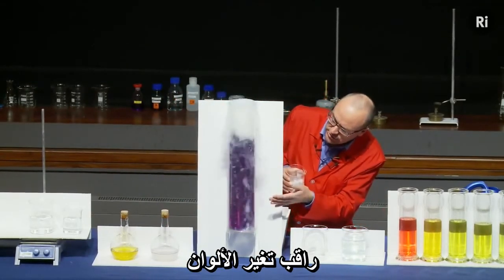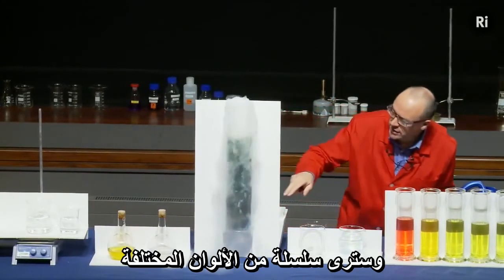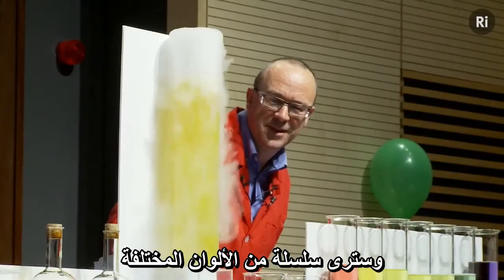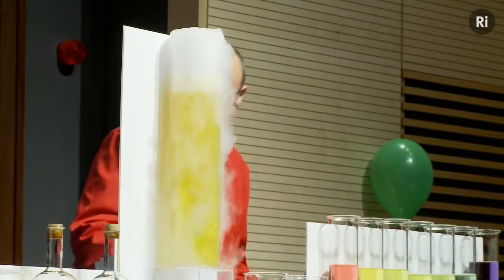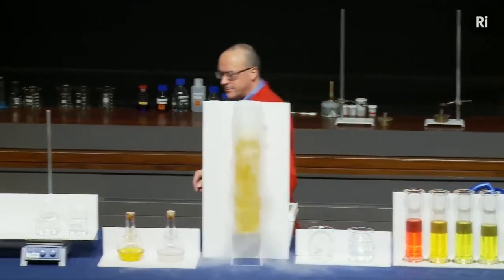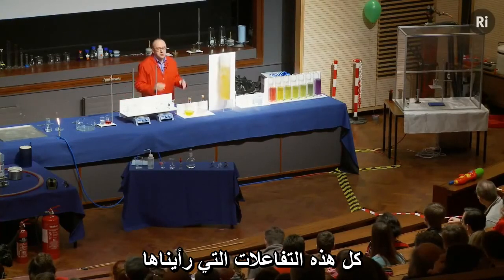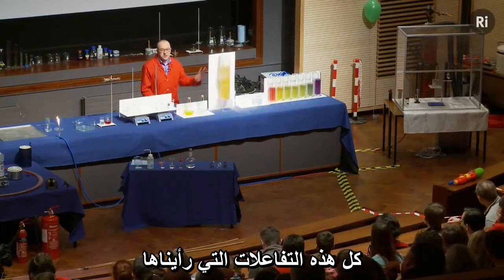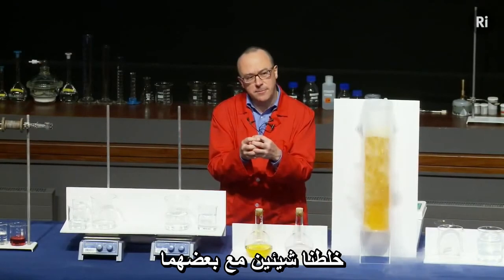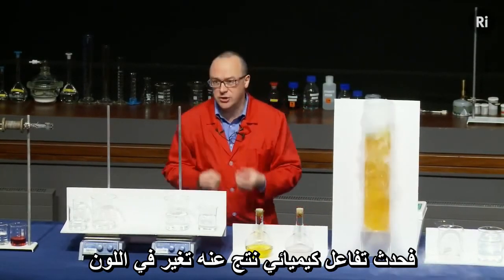Now watch for the colour changes — you should see that sequence of different colours. So in all the reactions we've seen so far, we mix two things together, it produces a chemical reaction which gives rise to a colour change.